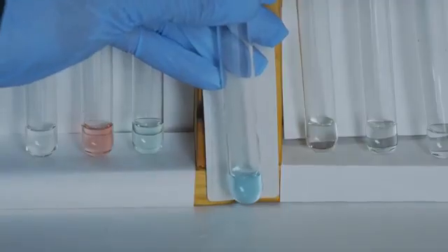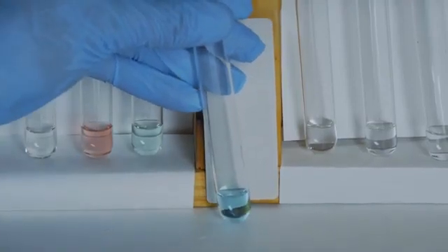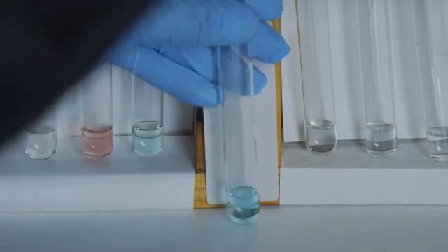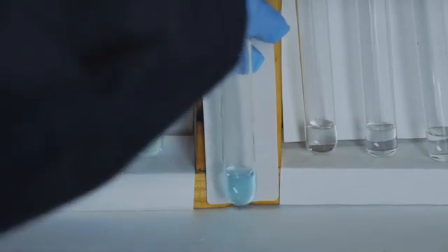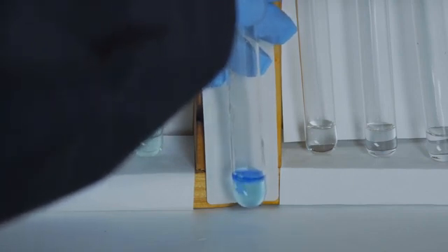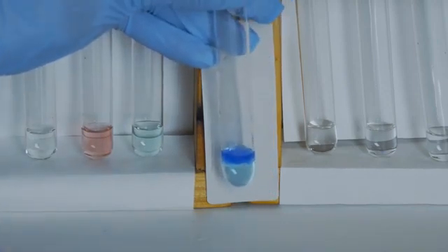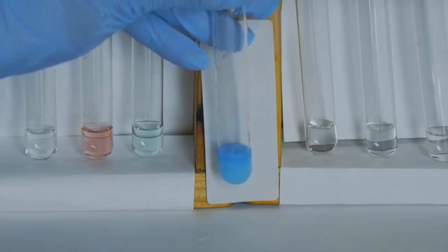To our unknown solution C, which is blue in color, we add our 3 drops of ammonium chloride and 5 drops of ammonium hydroxide. This forms a blue precipitate, and upon shaking, the solution becomes cloudy.